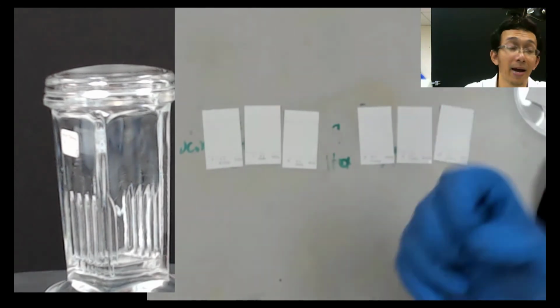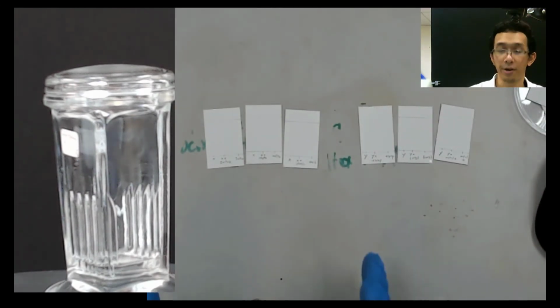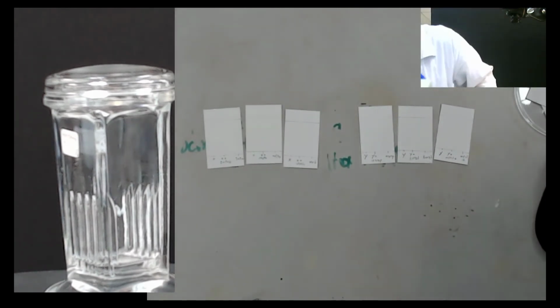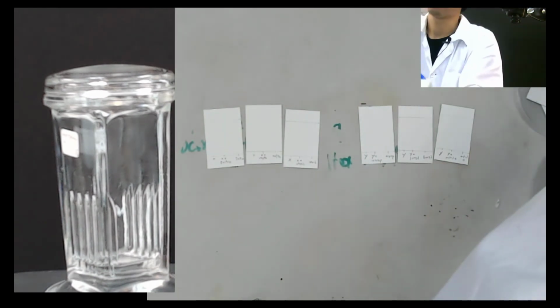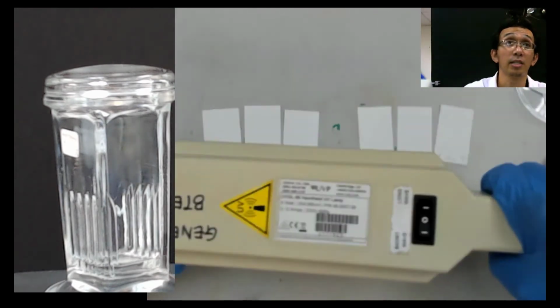That's why they bind with the gypsum that we discussed in the beginning. To see that, we let it dry for a while. Maybe this is already dry. So we use our what? Question. UV light. Yeah, who is that? What's your name? Mariam. Okay, so we use this UV light.